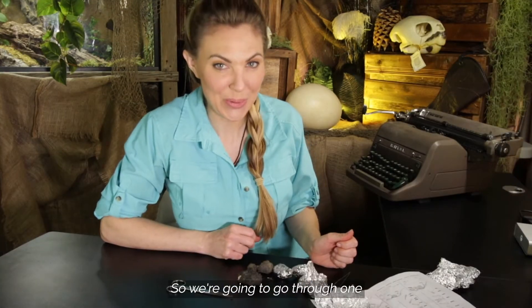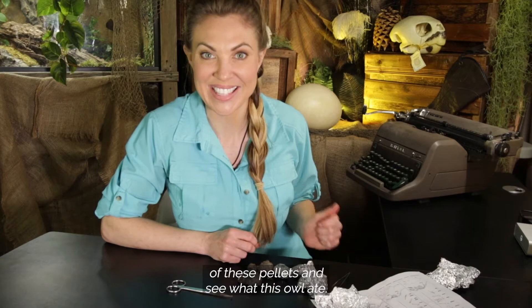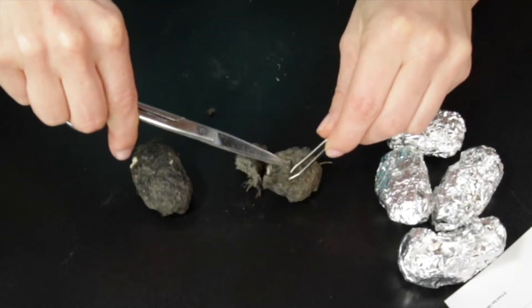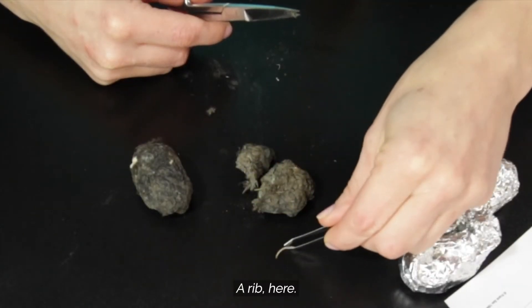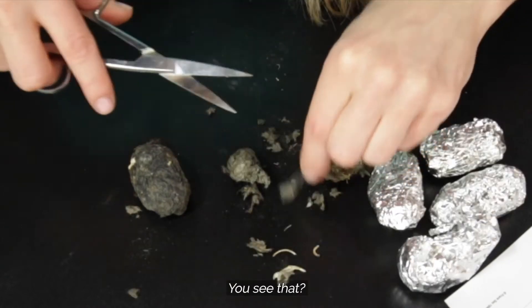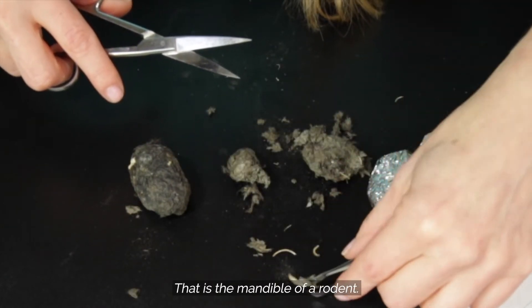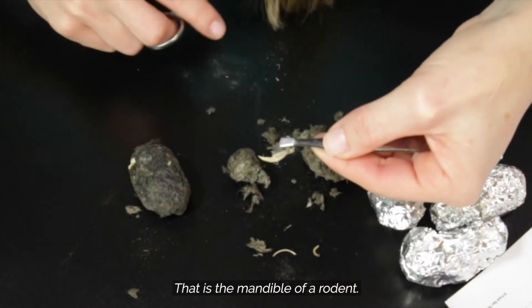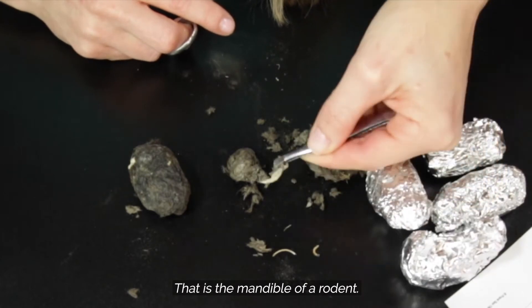So we're going to go through one of these pellets and see what this owl ate. A rib here — that is the mandible of a rodent.